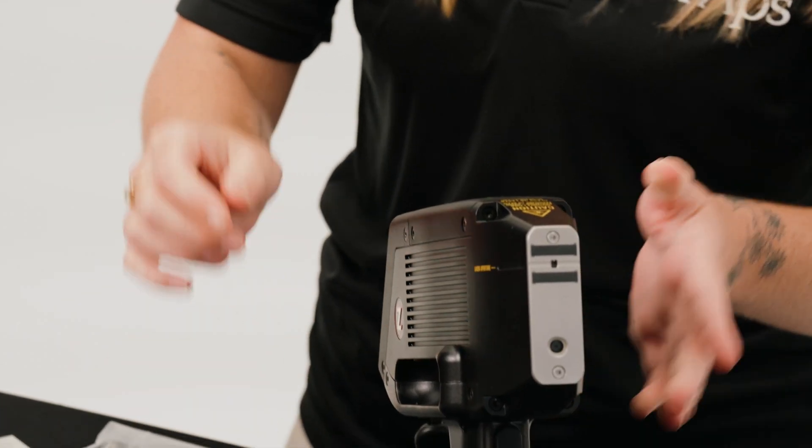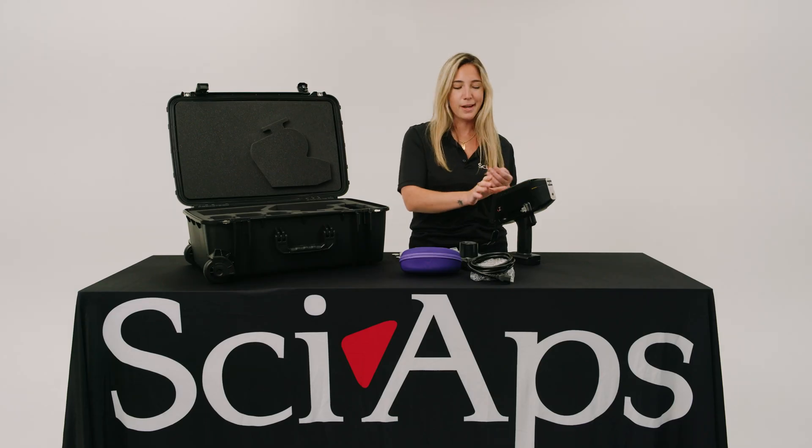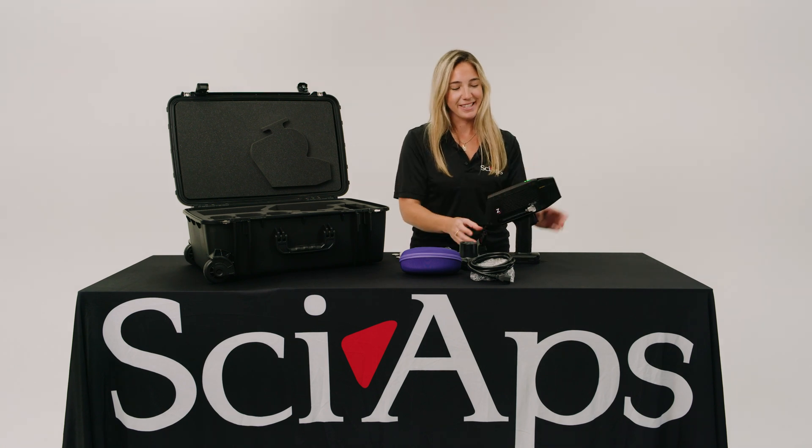The O-rings go right here and are replaced using your Allen wrench. If you would like to learn how to replace those, please visit our YouTube channel and search the video on how to replace these on our Z9 series.